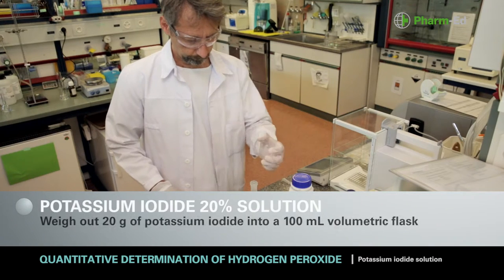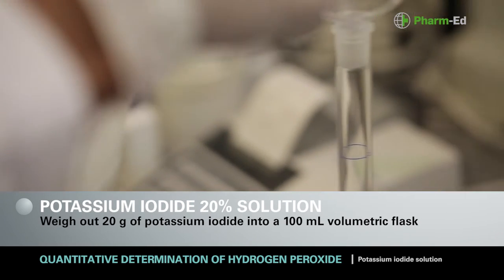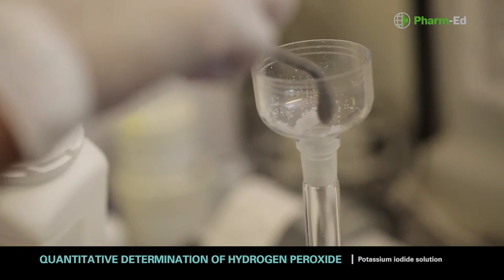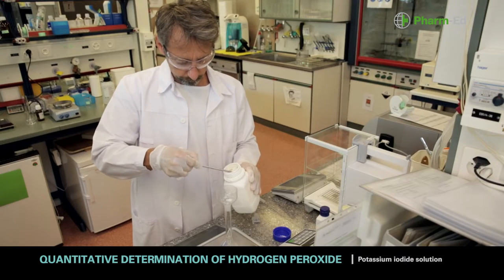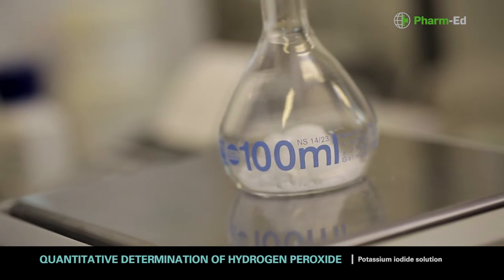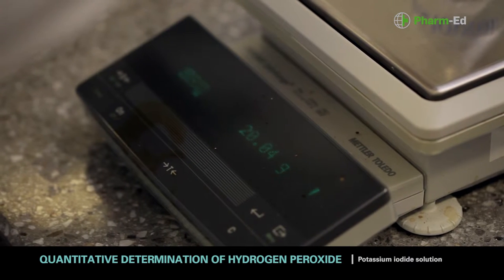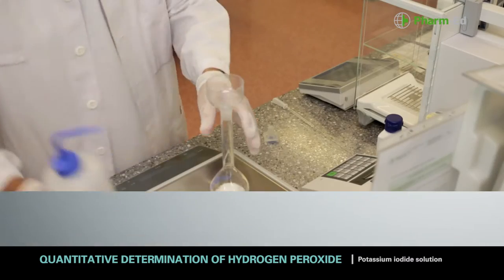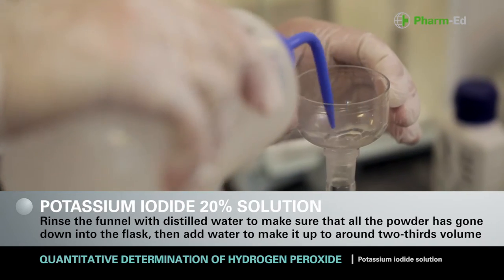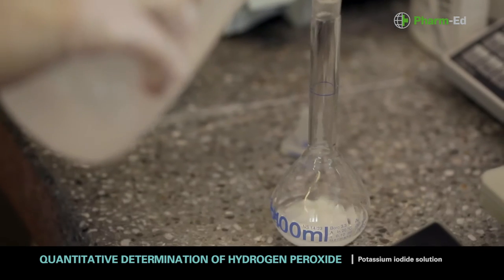Weigh out 20g of potassium iodide into a 100ml volumetric flask. Rinse the funnel with distilled water to ensure that all the powder has gone down into the flask, then fill it to around two-thirds volume.